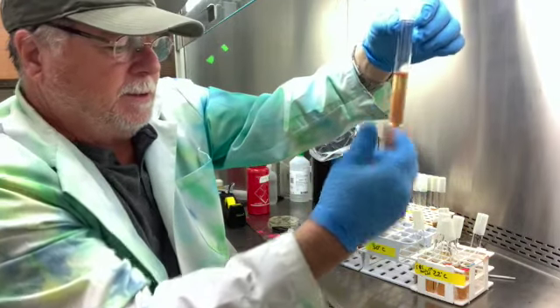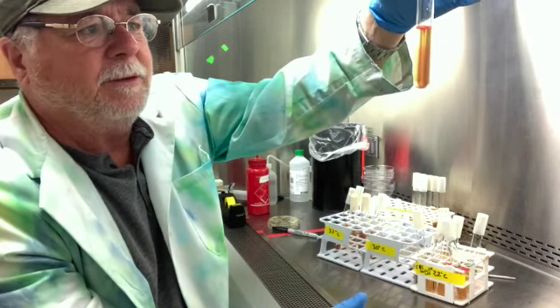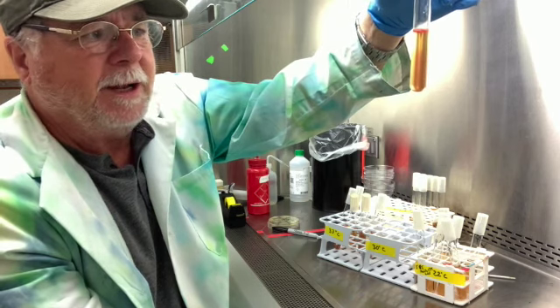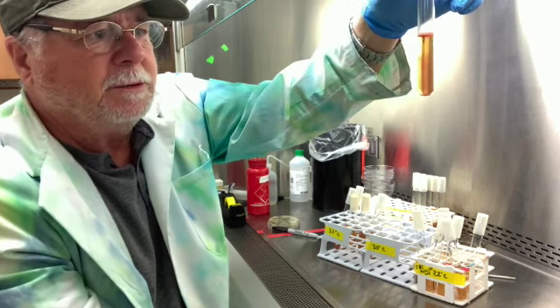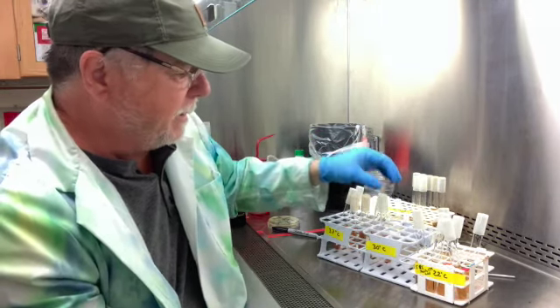Number six, this is number six, Bacillus megaterium. So there's pretty good growth near the surface, but nothing really substantial down below. So this is an aerobe, and it is not motile. It's not swimming. So that was number six, Bacillus megaterium.